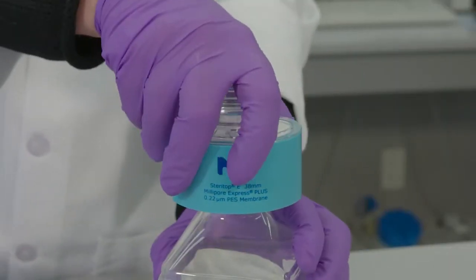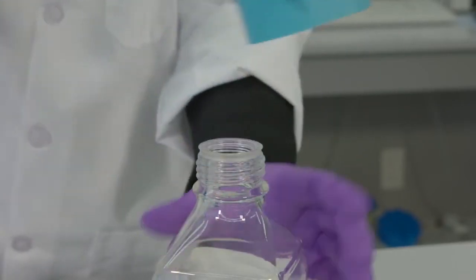For the SteriTOP E system, unscrew the collar from the bottle until it can be lifted off.